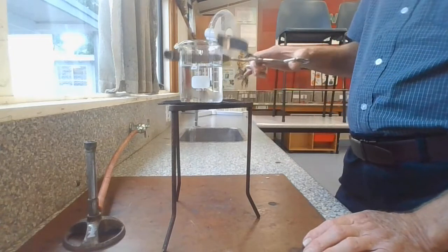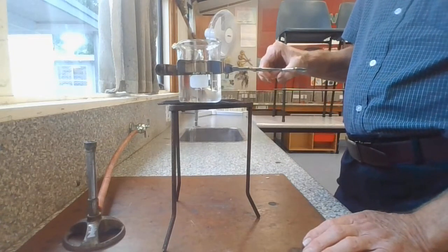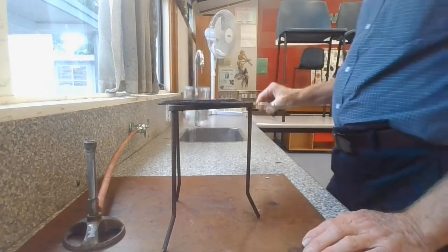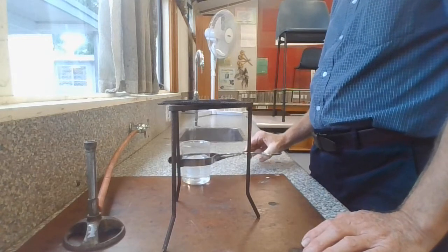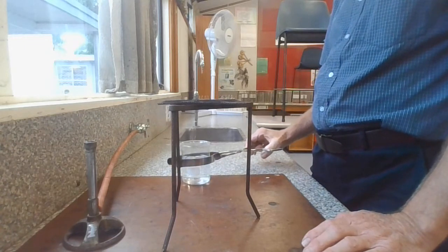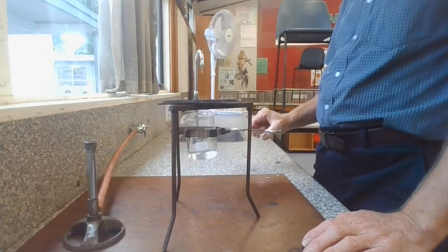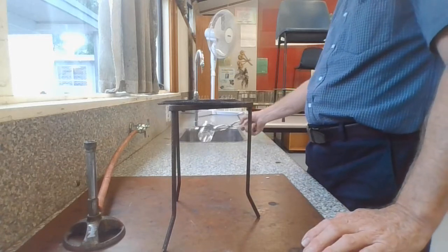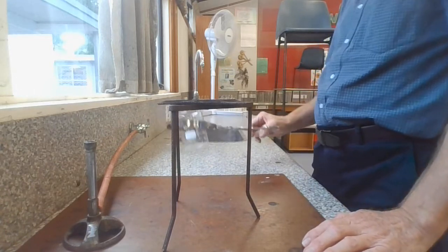For a hot beaker, use beaker tongs. Grip it firmly. Beaker tongs are not for carrying hot liquids around the room. They are purely for taking them off the tripod and when necessary emptying them down the sink.